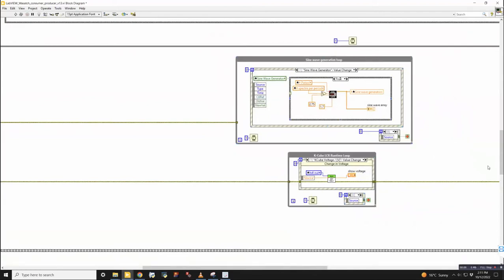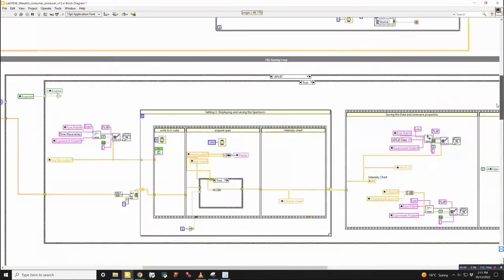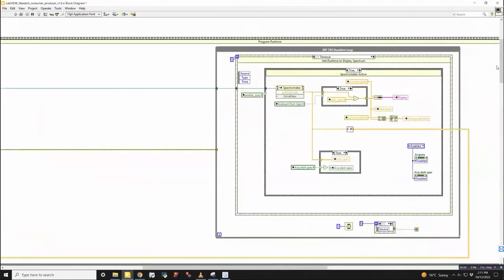And we also have one that generates sine waves, and then another one that handles all the file saving as well. So that one button basically triggers an event in every single while loop that's in the program runtime frame to stop running. And your program will not run unless you've figured out a way to stop a while loop, or else you'll get into an infinite loop and you'll never be able to stop the program and it can go out of control. So that's basically the principle here, is that we have a while loop for each hardware that's connected, at least, and then typically more while loops.